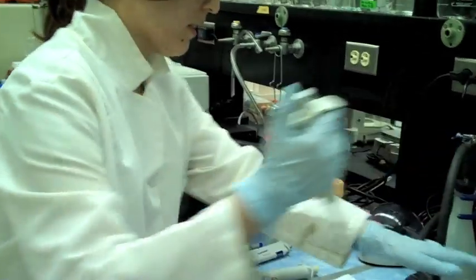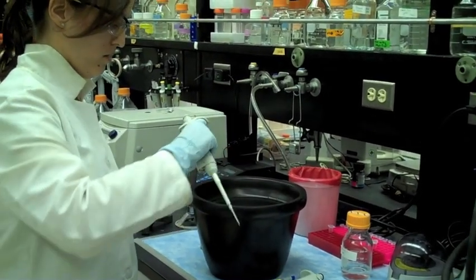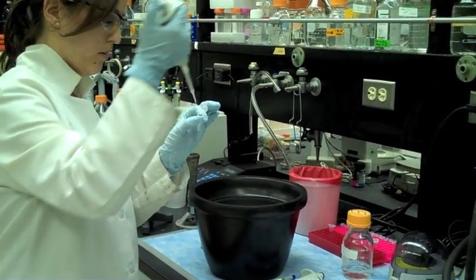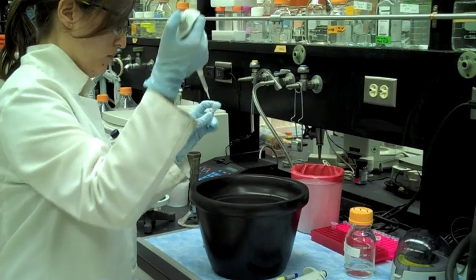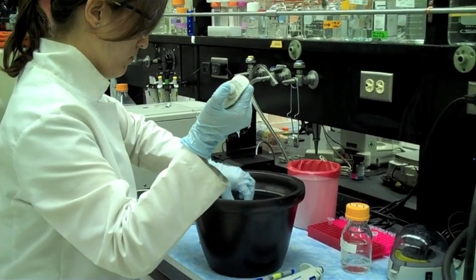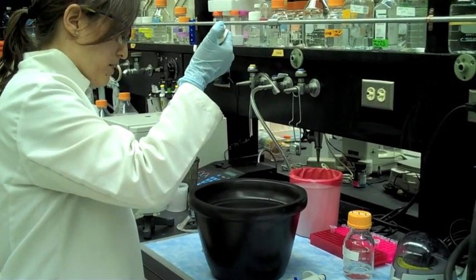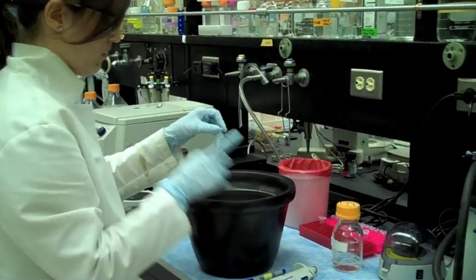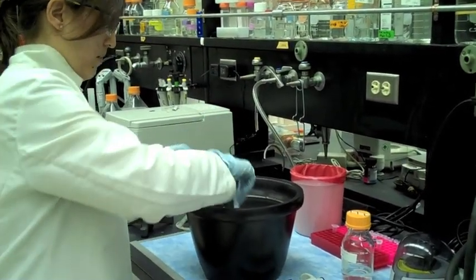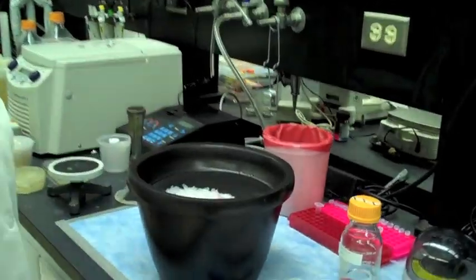Next, I'm going to add my DNA. It's also a very small volume. Gently mix the two together. Tap to mix. Then store it on ice and wait for 30 minutes.